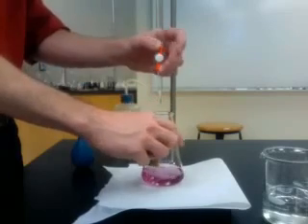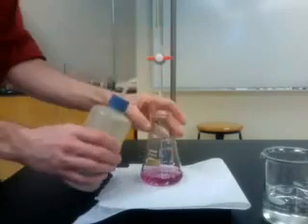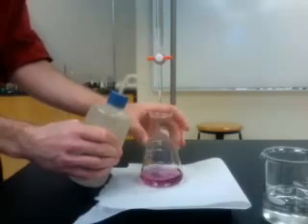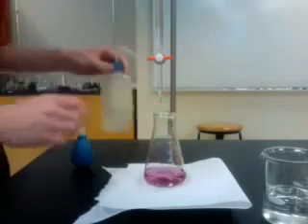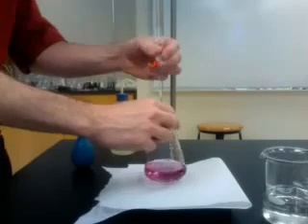As with all titrations, you should ideally swirl the flask as much as possible to ensure the reaction proceeds fully. You also want to rinse down the sides of the flask on occasion to make sure that no titrant or analyte is splattered up onto the edges of the flask.